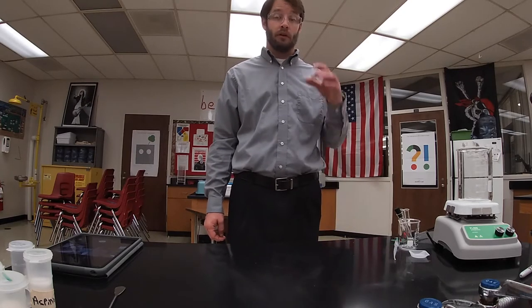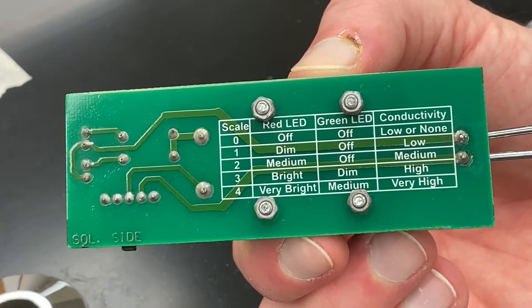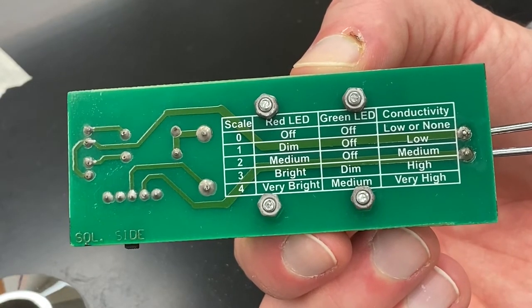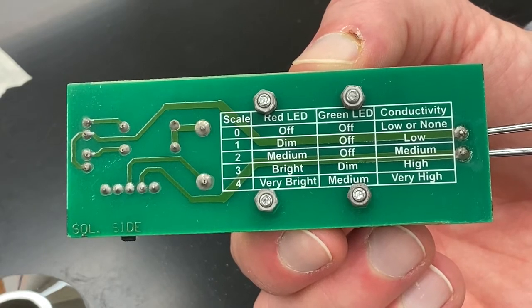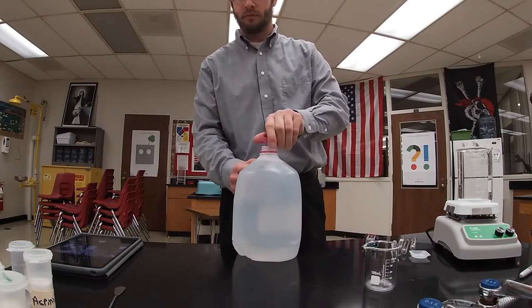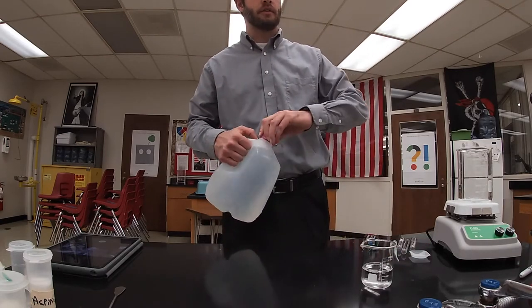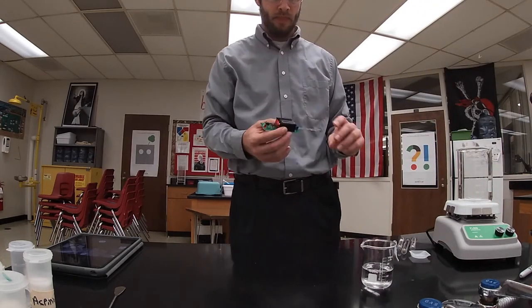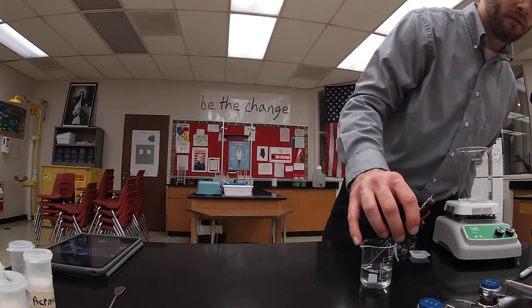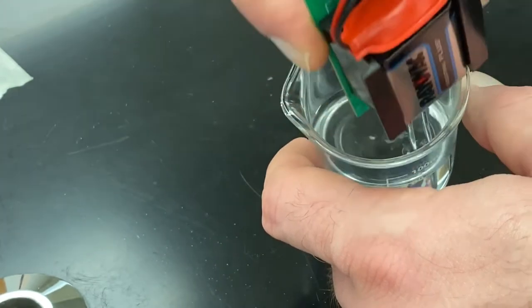The next thing I want to do is determine the solubility of my samples in water, and if they do dissolve, check their conductivity with a conductivity tester. The conductivity tester shows different levels of conductivity ranging from low or none to very high, depending on the combination of the red LED and the green LED. First, I'm going to add distilled water to the beaker and check the conductivity of pure distilled water. When I test it, we can see there is no conductivity for pure distilled water — the LEDs are not lighting.